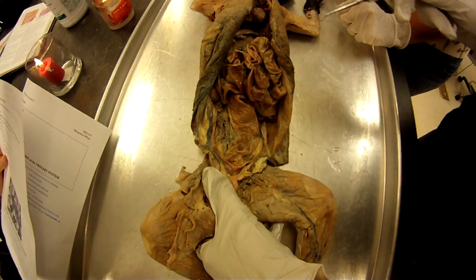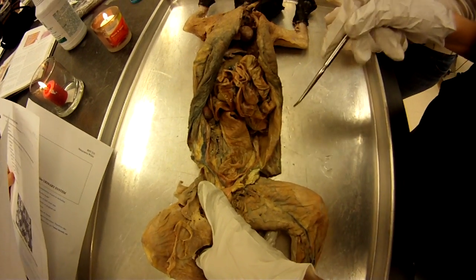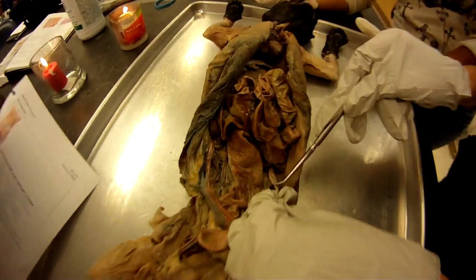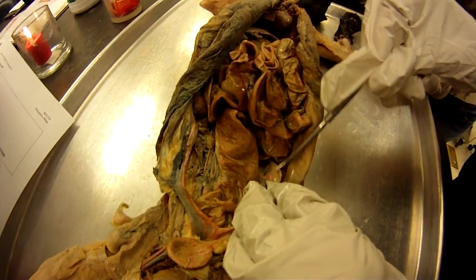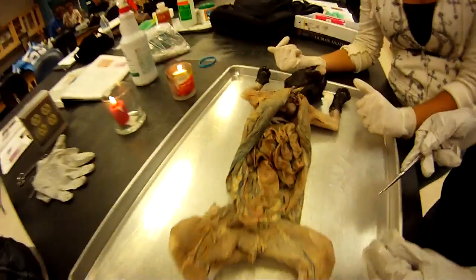Then you're going to move up to the fallopian tube and then the ovary. That's part one.